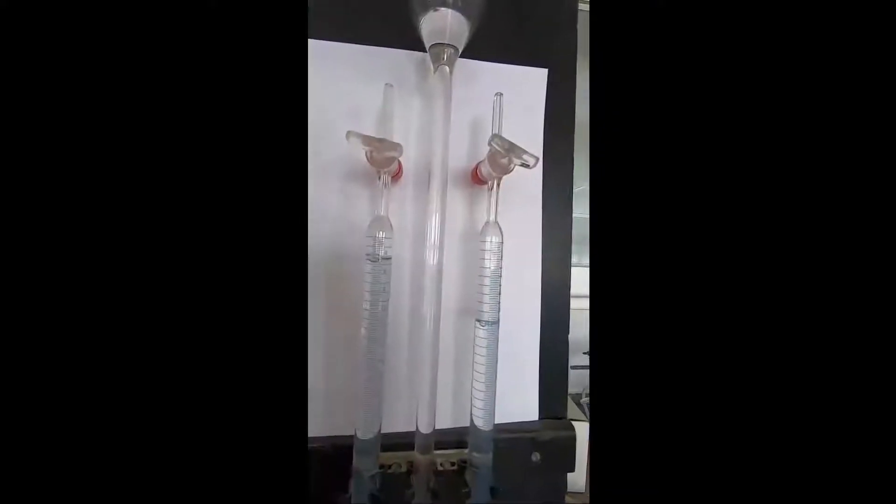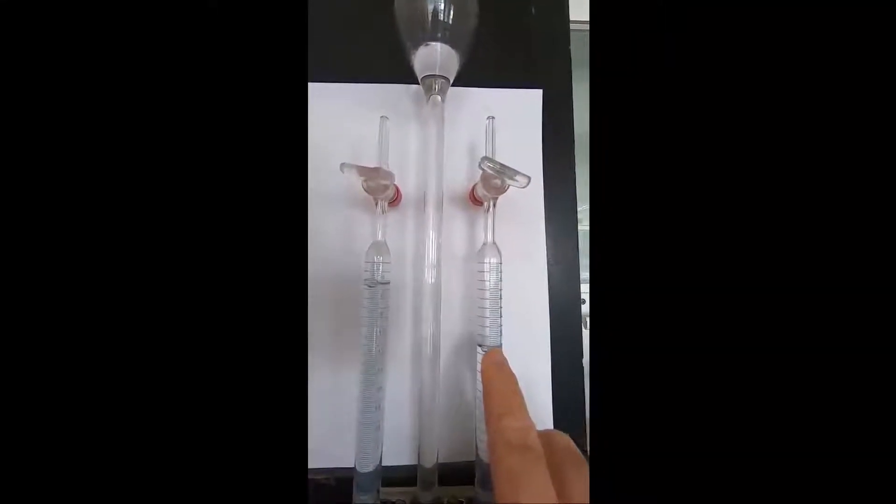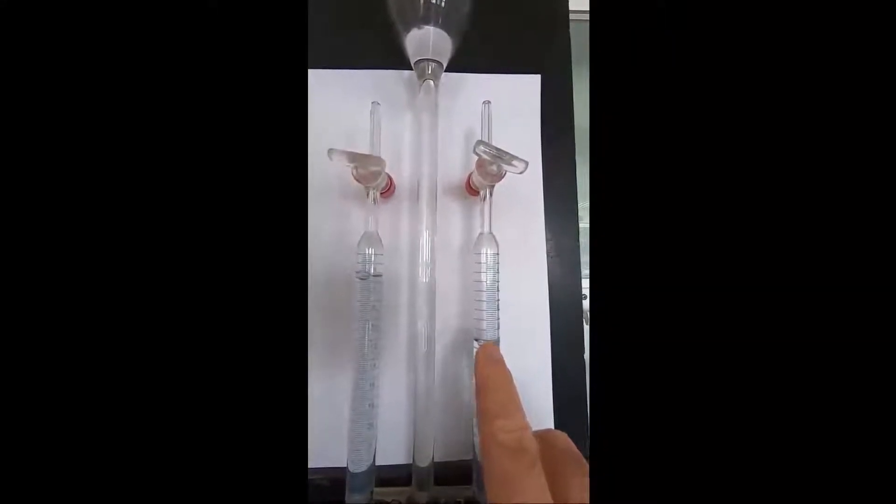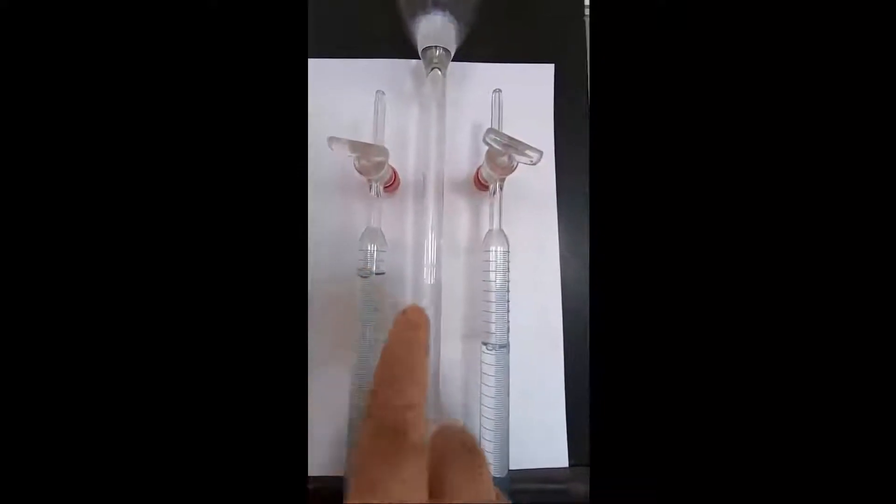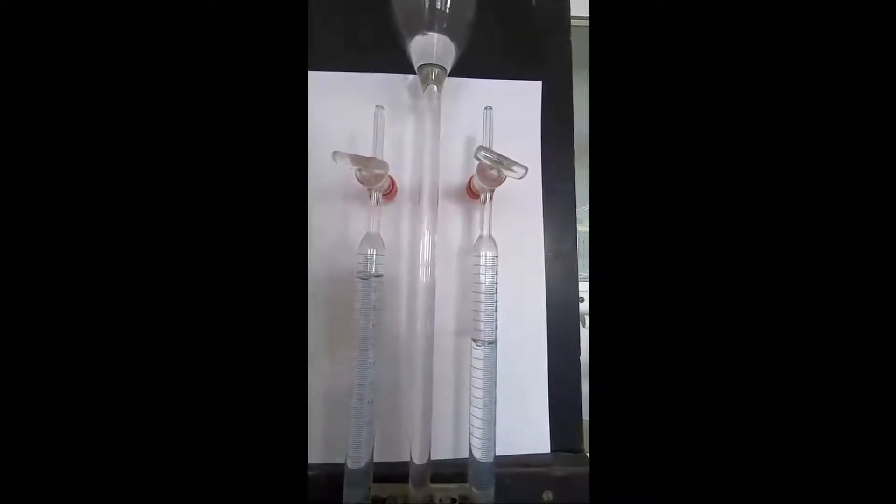The experiment's been running for a few minutes now, and you can see we've got quite a lot more gas in the right-hand side tube than we have in the left-hand side. We'll come back to it a little bit later on to see how it's going.